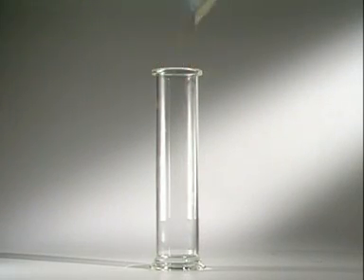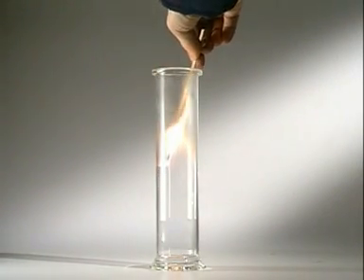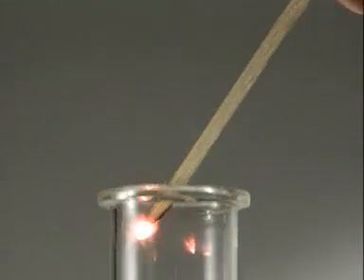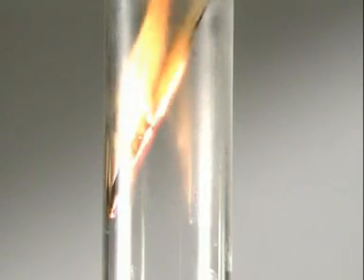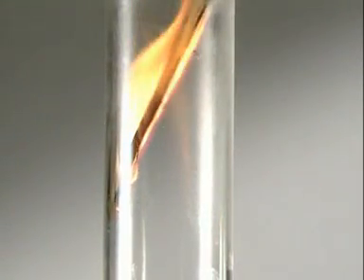This jar is full of oxygen. A glowing splint immediately relights. Oxygen reacts with most elements.